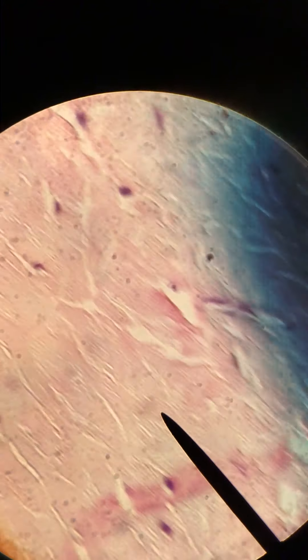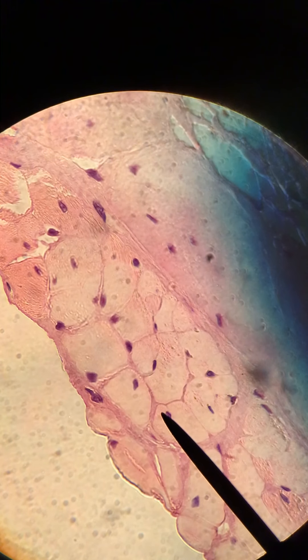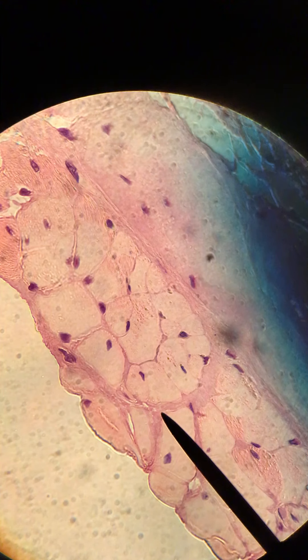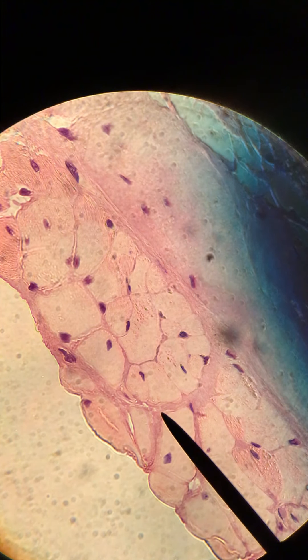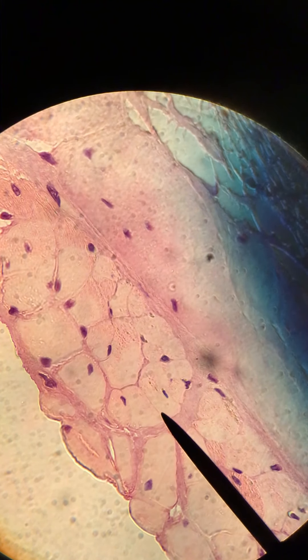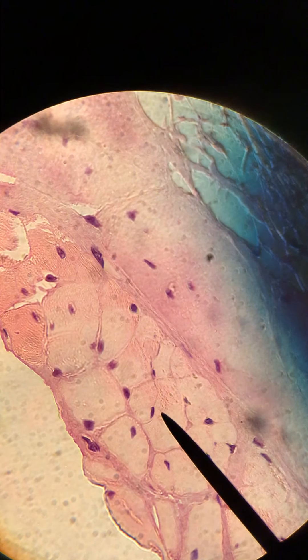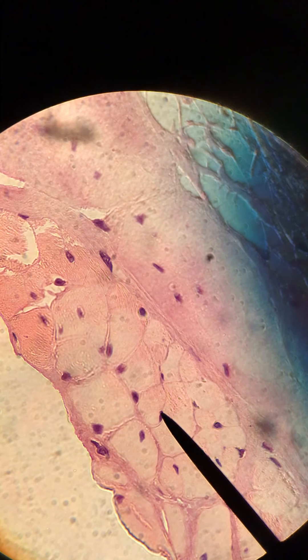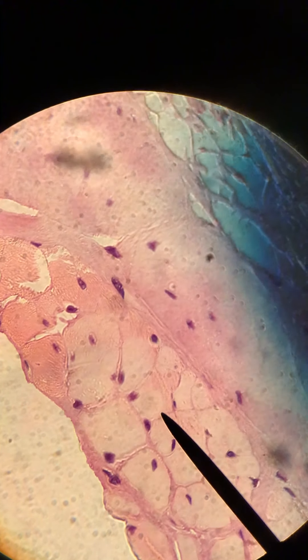The last thing we are supposed to find is skeletal muscle. So I'm going to scroll down to where I saw it before. This is skeletal muscle and it's cut as if the fibers — the muscle fibers — were coming out of the screen towards you, so this is like the cut ends of those muscle fibers. You can see that they have a peripheral nuclei — see this here is along the edge, the periphery of the muscle fiber — and again you can see more over here and here.